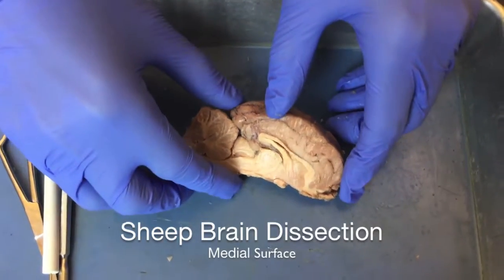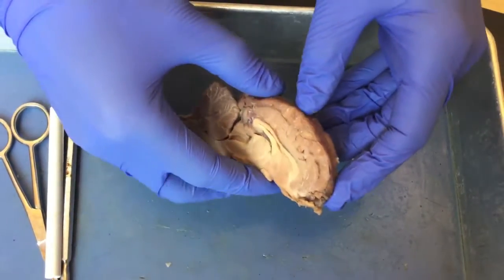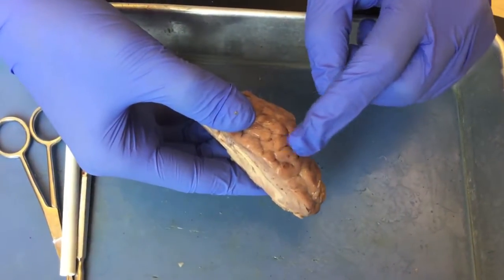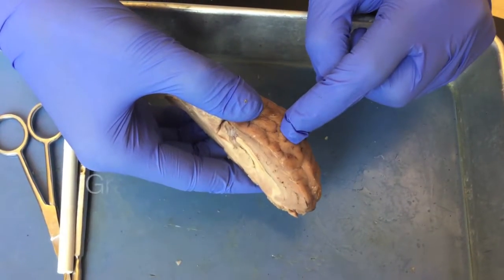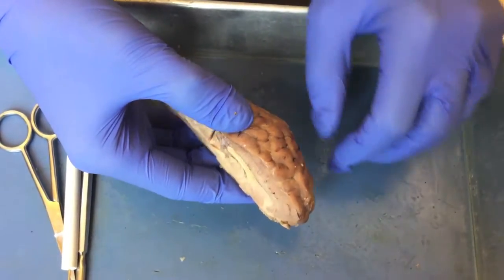Now that we've done the dissection, we can see that the inside of the brain has a lot of other structures. One thing to note is that on the superficial surface of the brain, you'll notice that the surface is brown or gray in color. And we call this gray matter. And the reason it is this color is because it's mainly made up of neuron cell bodies.